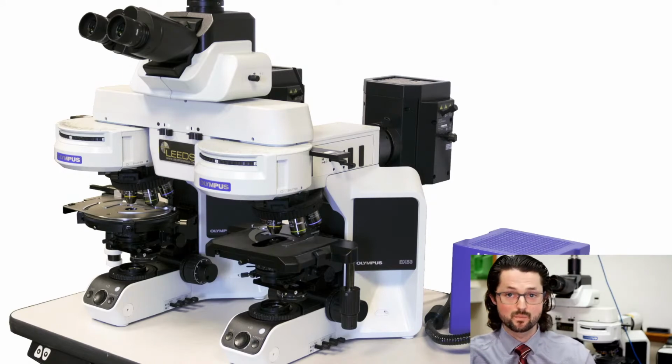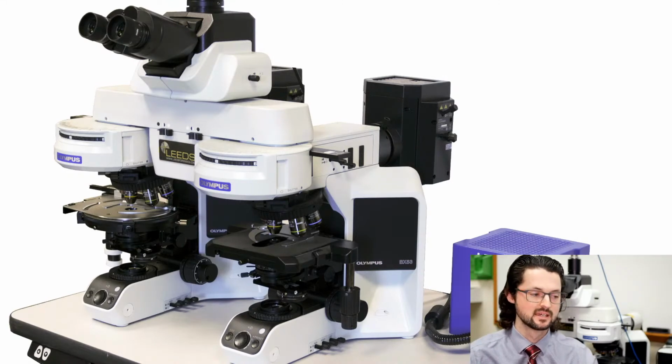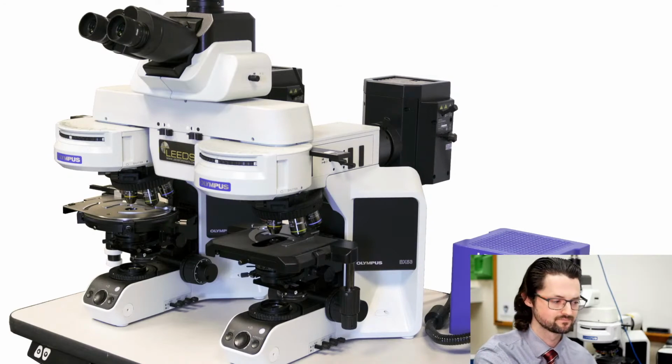There are reasons to pick mercury versus metal halide and metal halide versus mercury. One of the reasons I think some people are interested in metal halide is that it's not a burner that's directly attached to the scope. Generally, I think it has longer work hours. But the downside is you do have to replace those cables every once in a while because they'll naturally degrade.